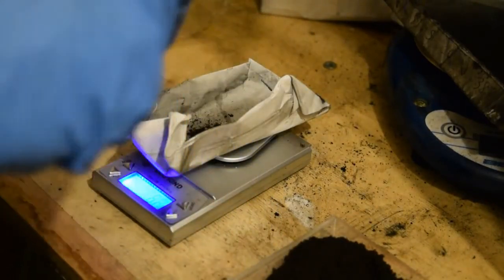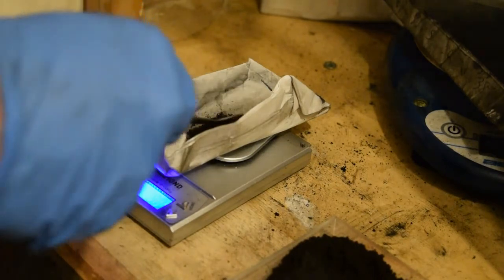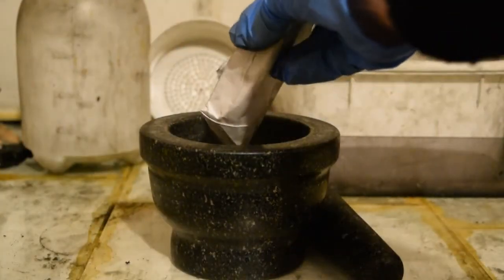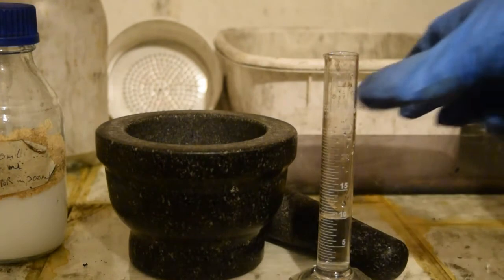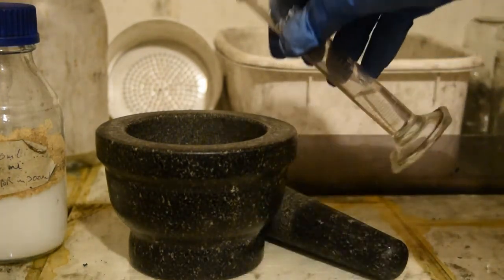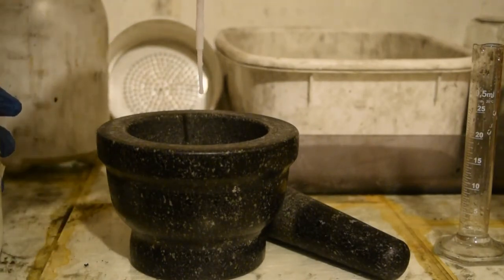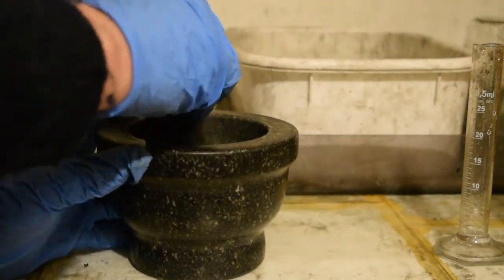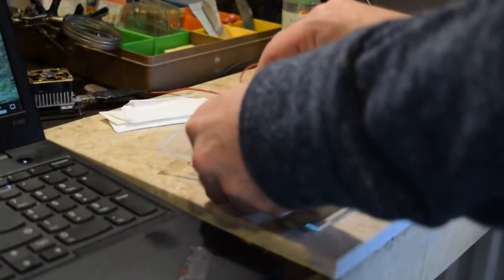I need to turn this into an ink to put on my graphite foil current collector. If you don't have graphite foil you could use stainless steel. I put 0.2 of a gram of the powder into a pestle and mortar along with 10 millilitres of deionized water and 5 to 10 percent by weight of binder. You can use PVA, but I made up some CMC-SBR binder which Rob has done a video on. Give this a good wet grind to turn it into an ink, then pipette 1 millilitre of the ink onto the graphite foil. There is now about 20 milligrams of active material on the current collector, which is important to know in order to calculate the energy density. Once it's dry, it's ready to test.